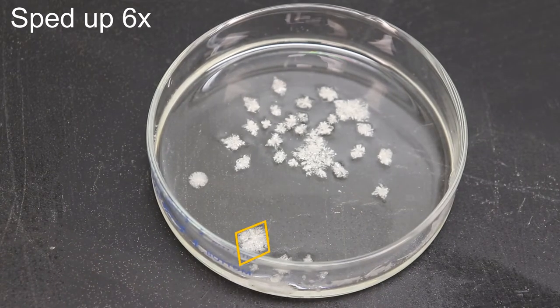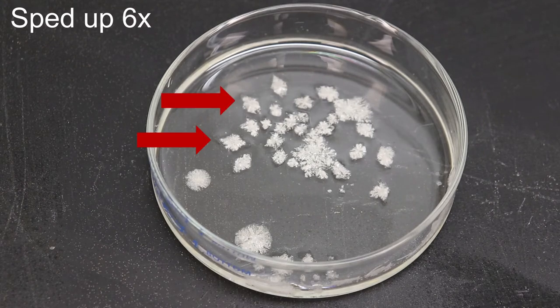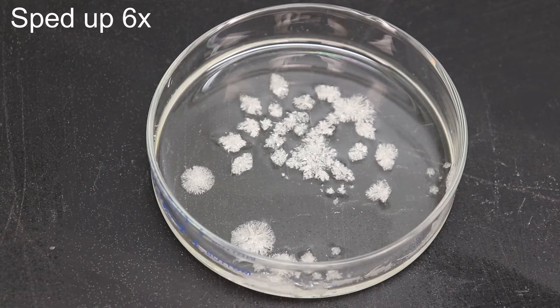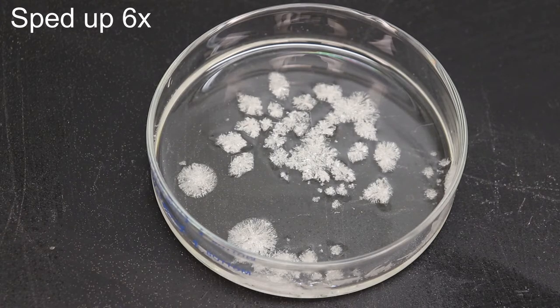See there? There's one there. Very rigid geometric shape. And there's a couple more there, and you should be able to see more throughout as they're growing. Under the right light, you can see the crystals are about one to maybe one and a half centimeters.